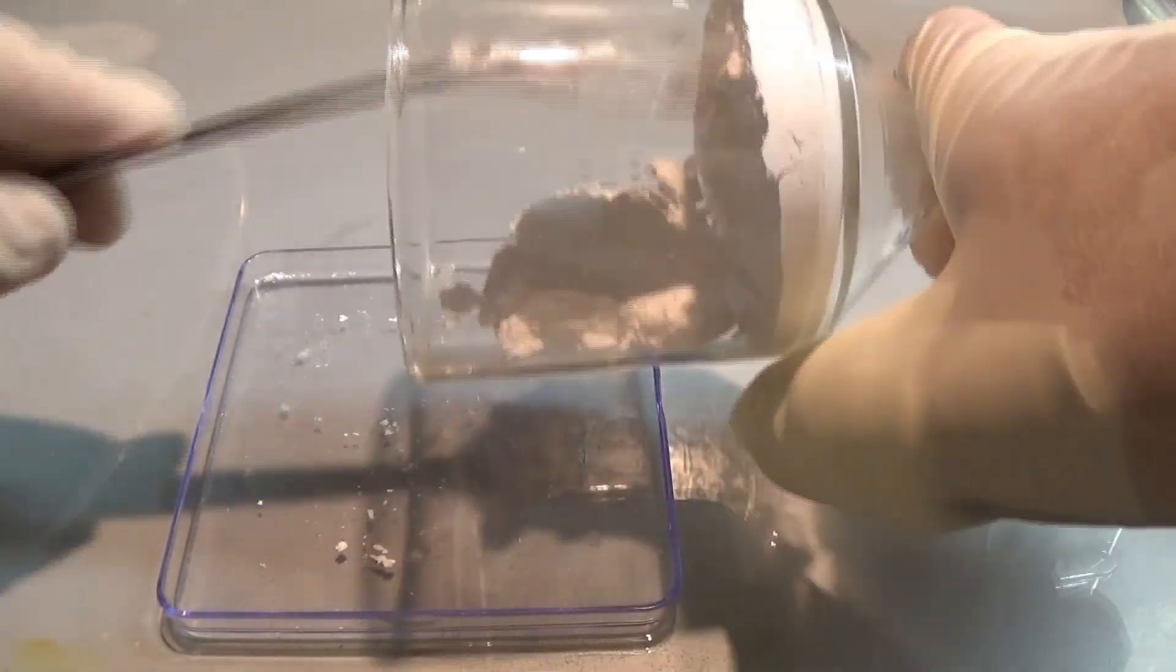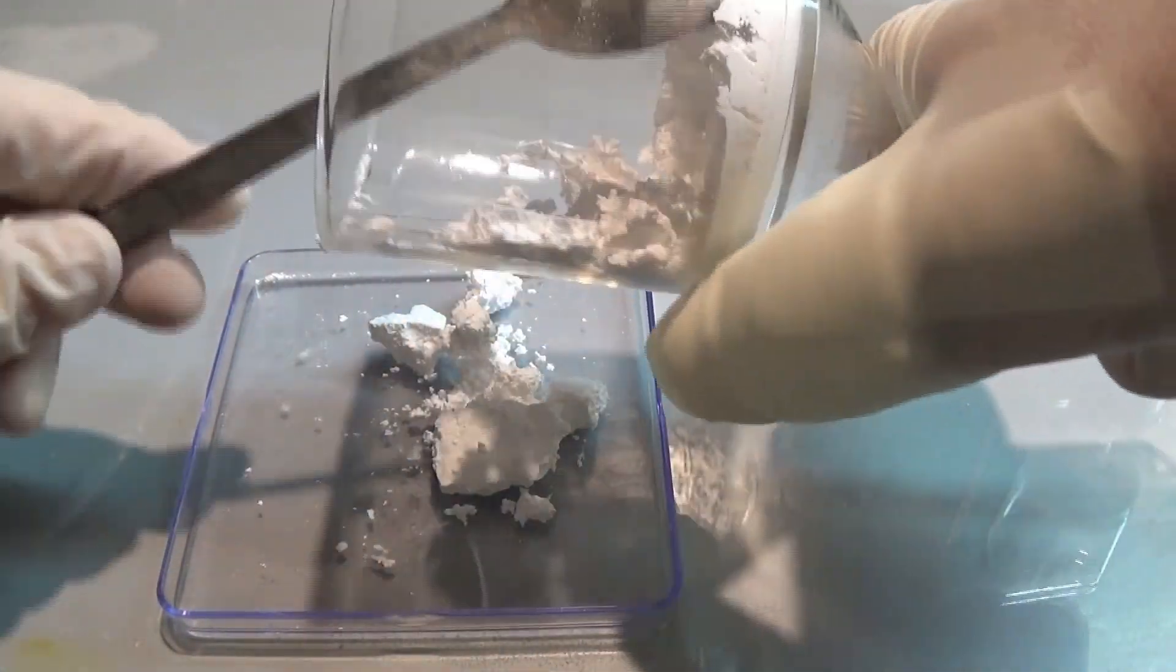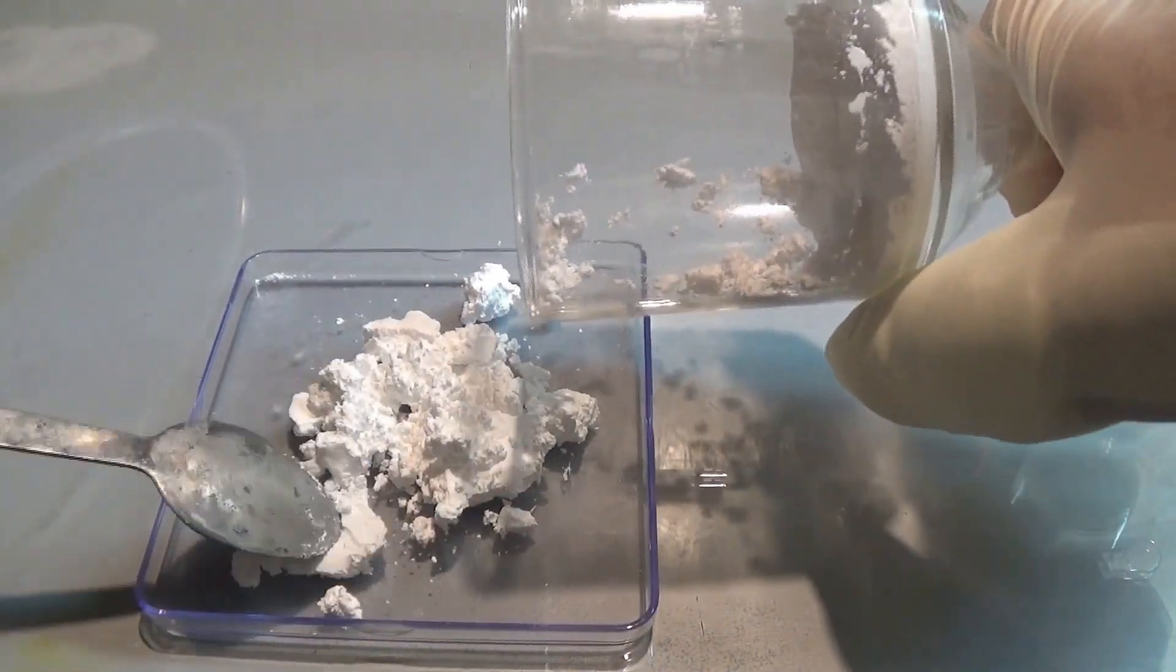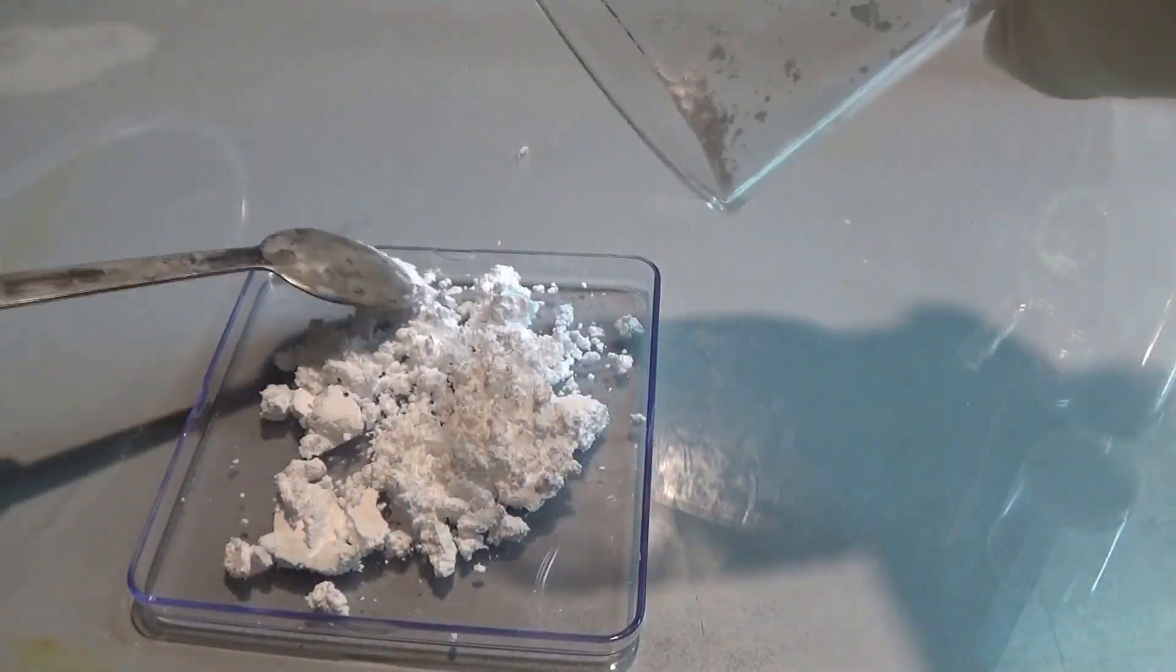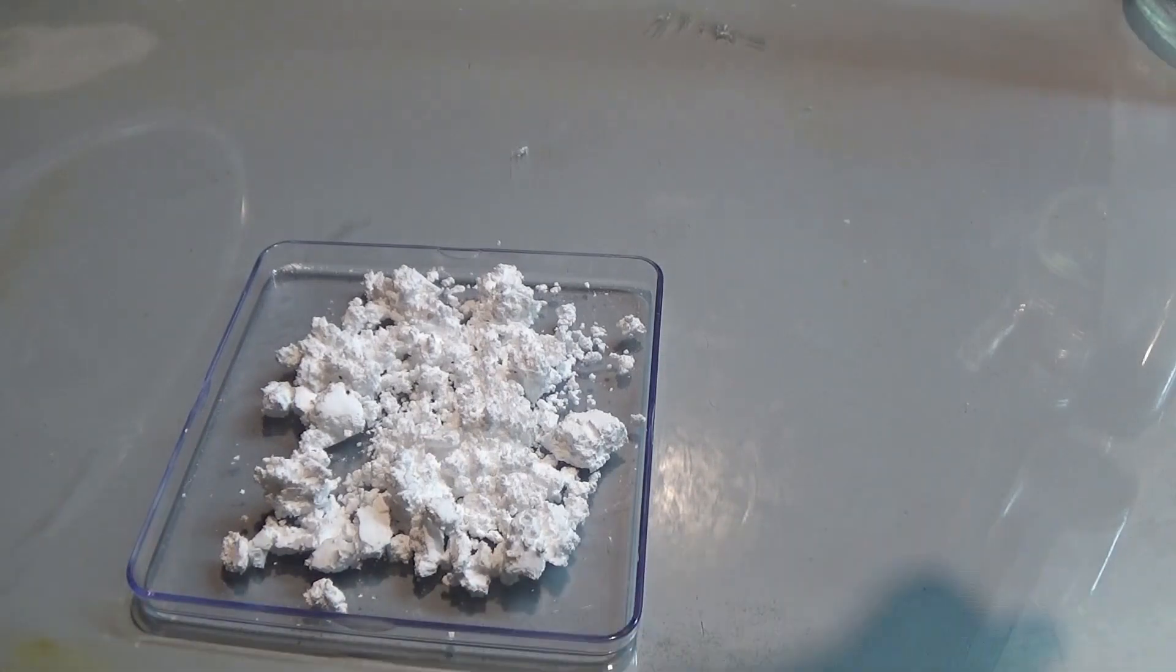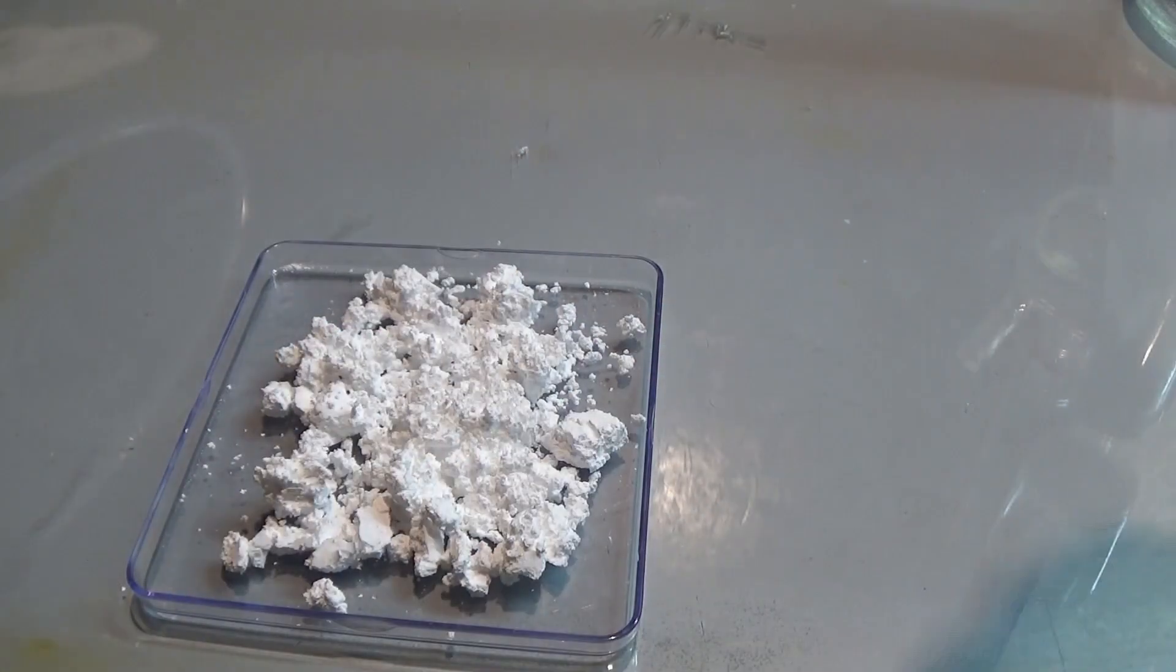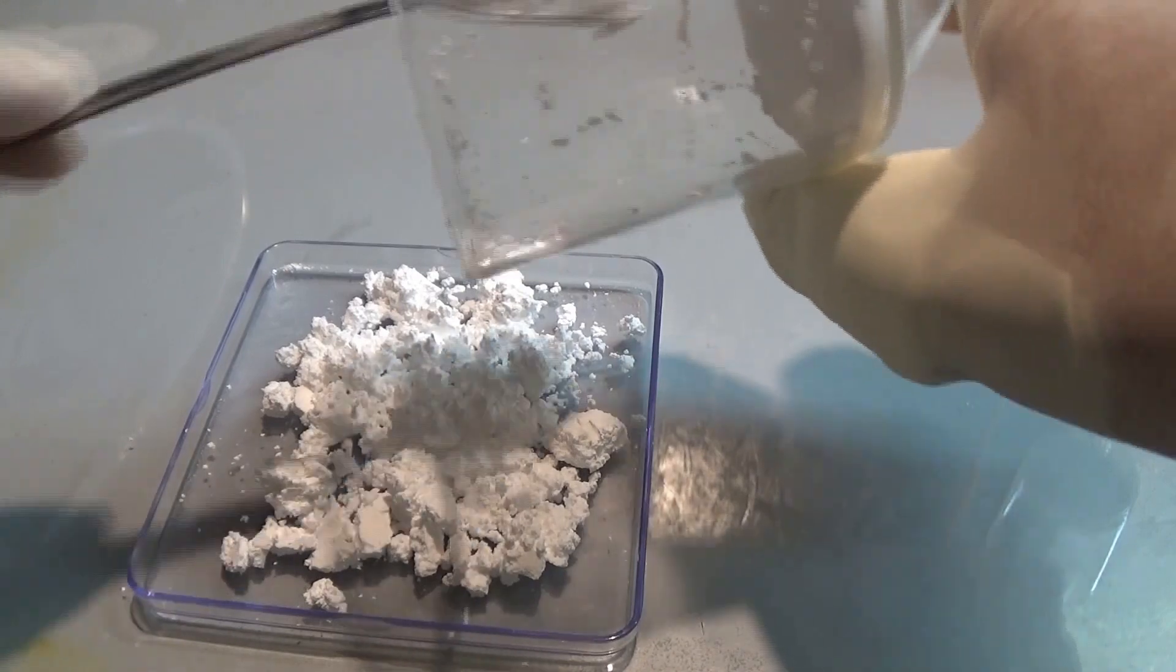The product was then scooped out of the filter and transferred onto a plastic dish to dry properly. So until this point I was very disappointed because I lost nearly all of my reaction mixture and did not get any nice shots for you guys.